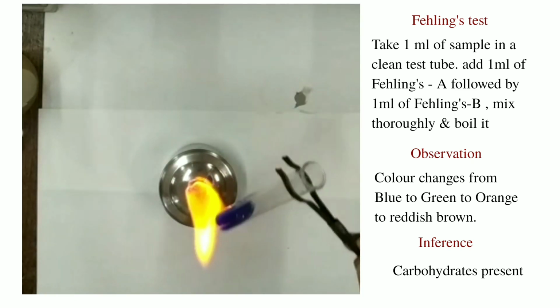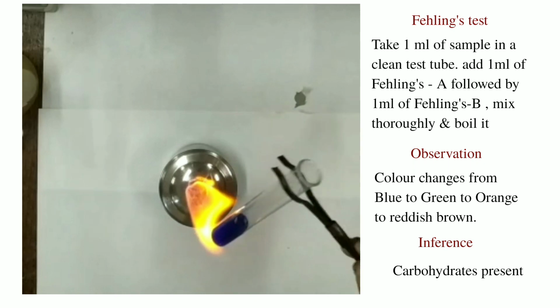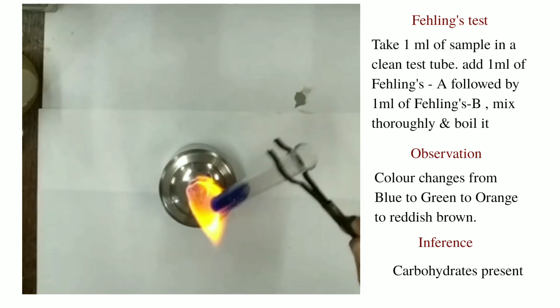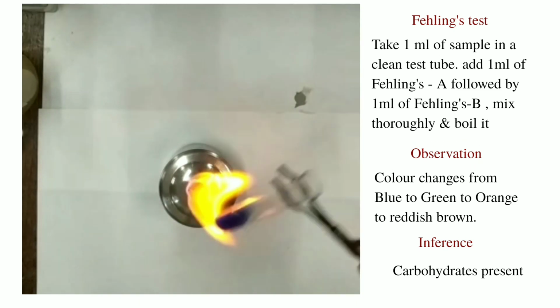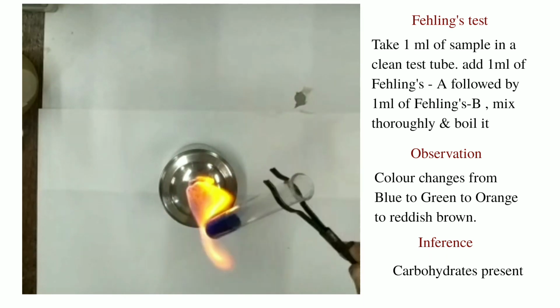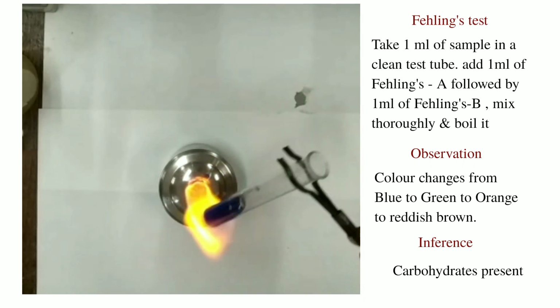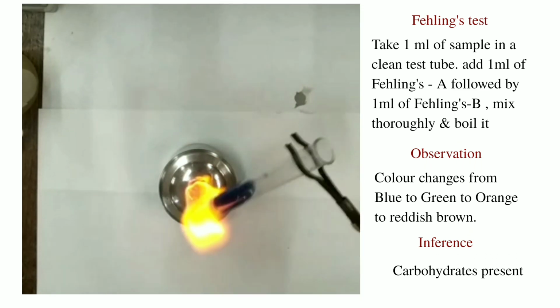Gently start heating the solution. So you can see it is blue in color. Slightly keep moving the test tube. It has slowly started boiling.